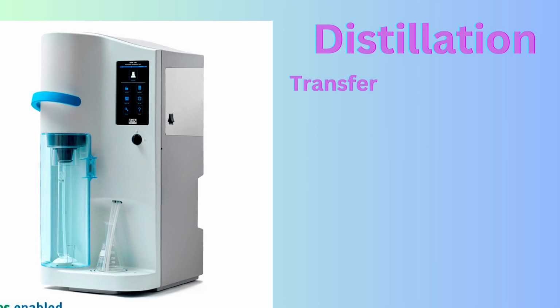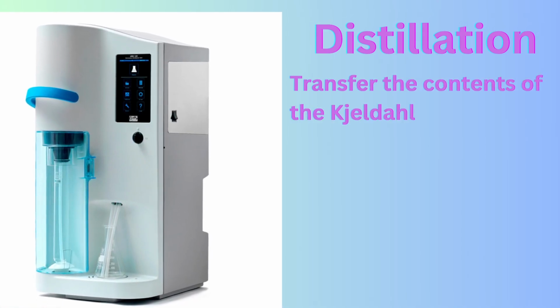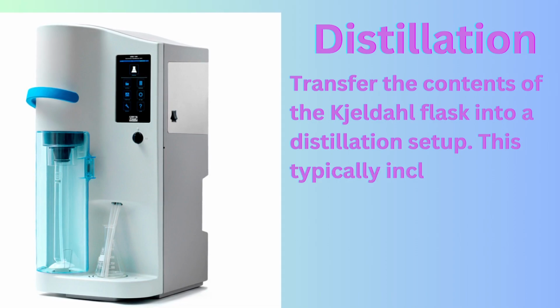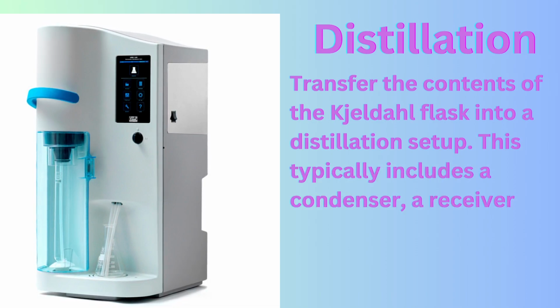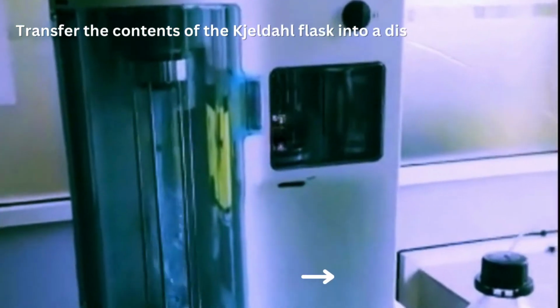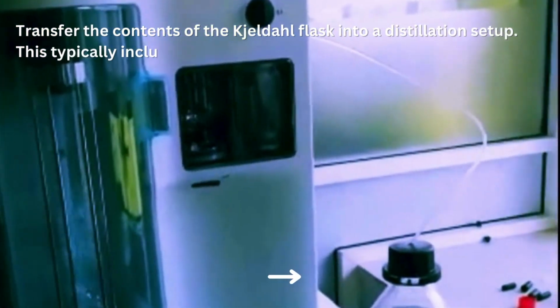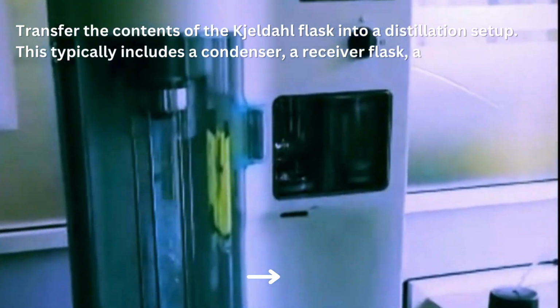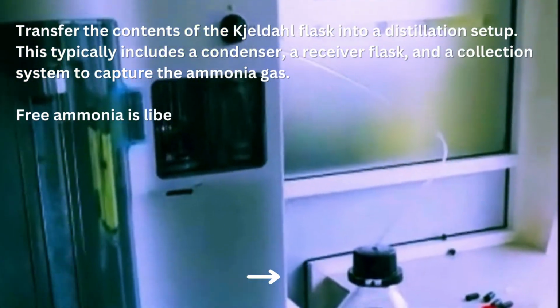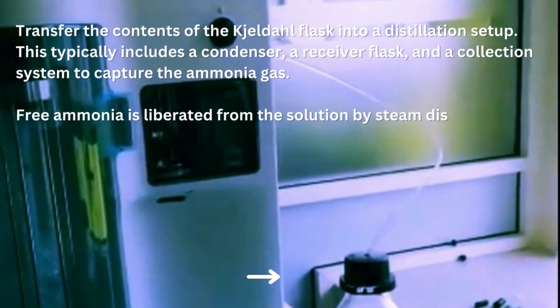Step 2. Distillation. After the digestion process, we move on to distillation. Transfer the contents of the Kjeldahl flask into a distillation setup. This typically includes a condenser, a receiver flask, and a collection system to capture the ammonia gas. Apply heat or steam distillation to the flask by continuously adding sodium hydroxide, but be cautious not to boil the solution vigorously. We aim to collect the ammonia gas, not the liquid.